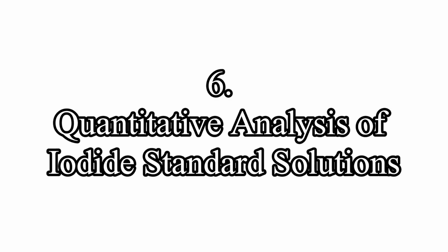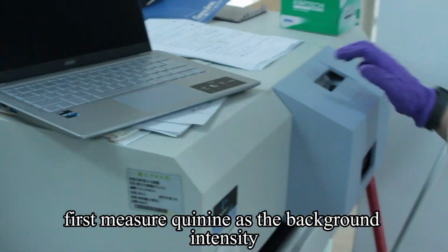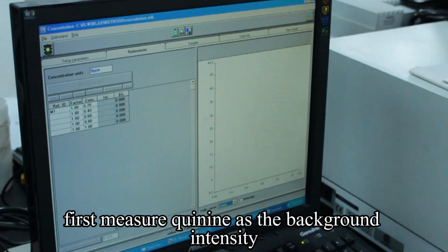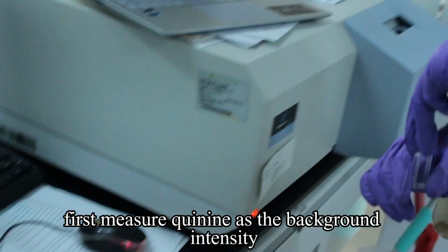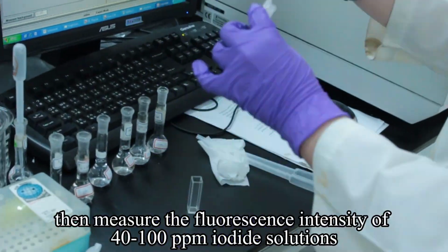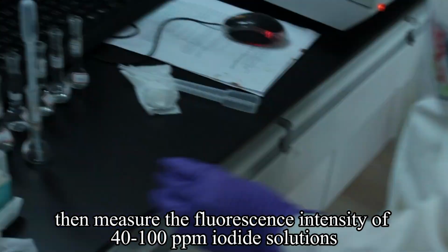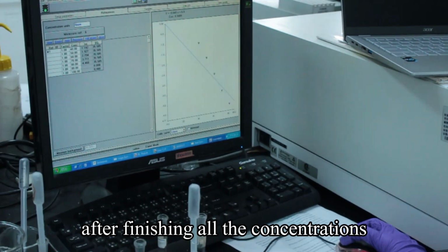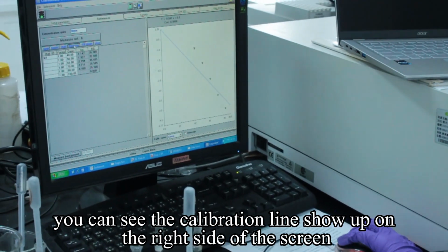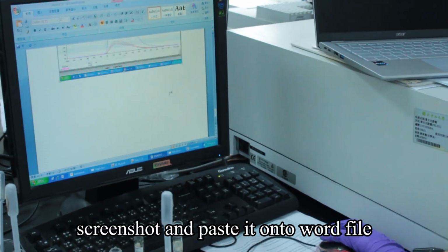Step 6. Quantitative analysis of iodide standard solutions. First, measure quinine as the background intensity. Then measure the fluorescence intensity of 40 to 100 ppm iodide solutions. After finishing all the concentrations, you can see the calibration line show up on the right side of the screen. Screenshot and paste it onto a Word file.